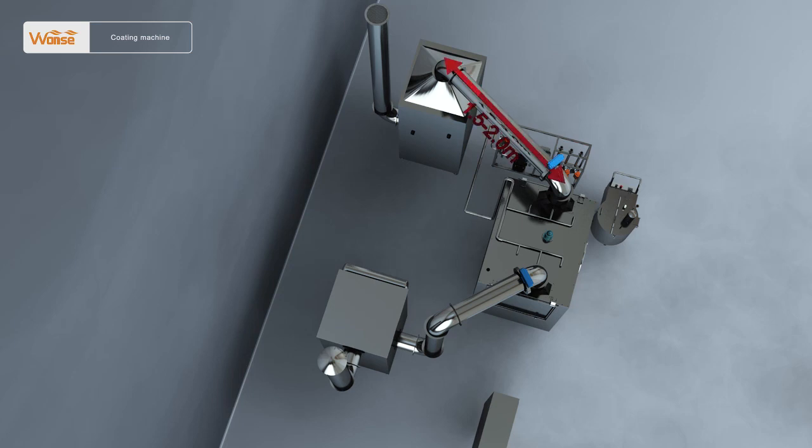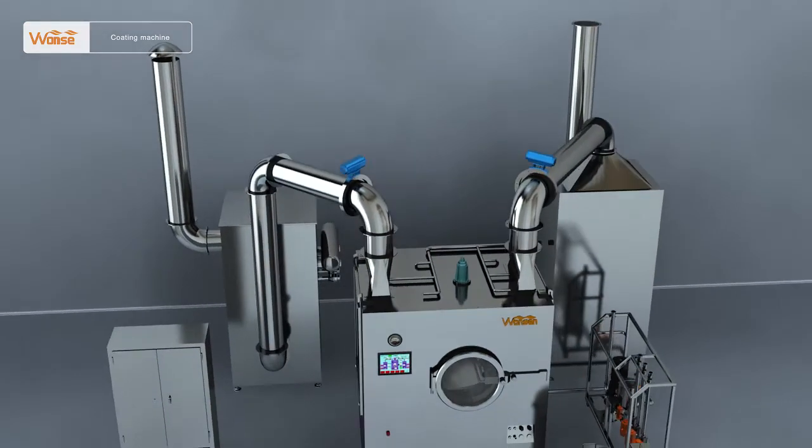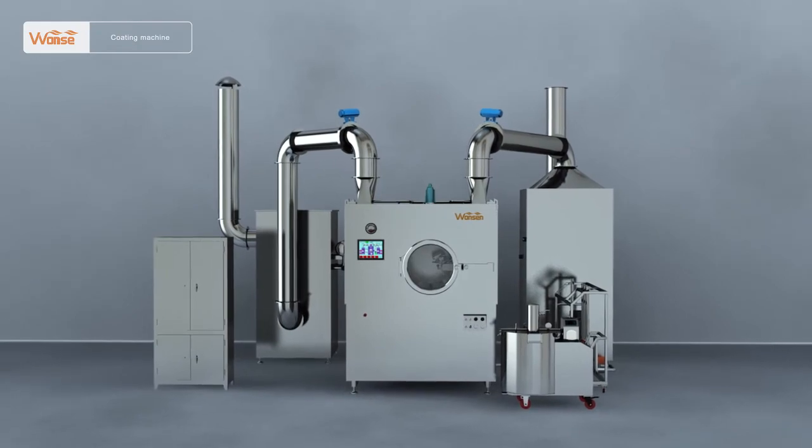Third, as for the connection of the hot air cabinet and air supply pipe, the hot air cabinet is installed at the right of the main machine, and a distance of 1.5 to 2 meters should be kept between the main machine and air pipe connected to the hot air cabinet to reduce energy loss whenever possible.